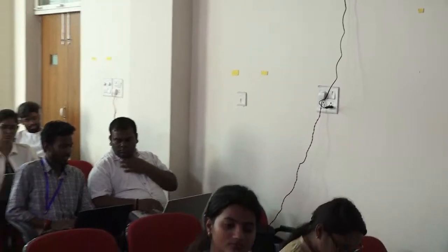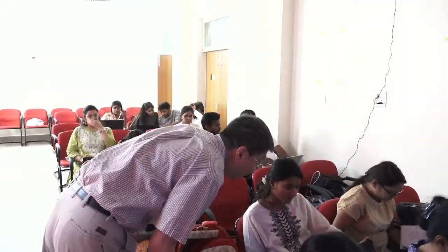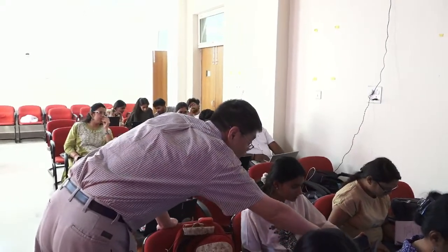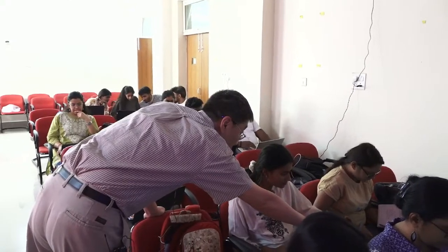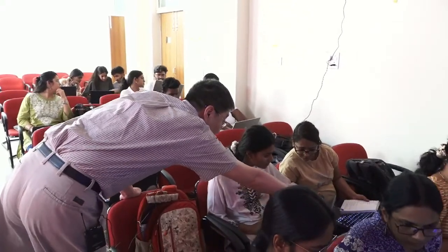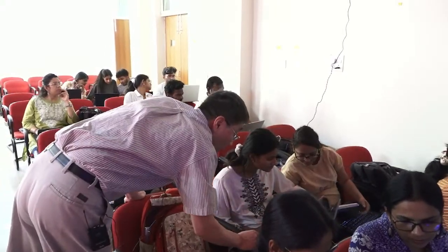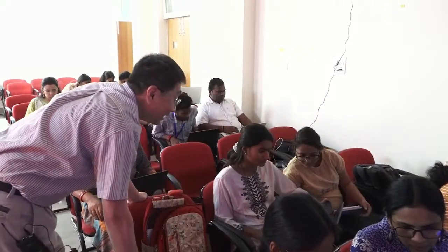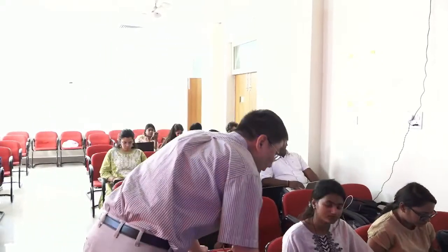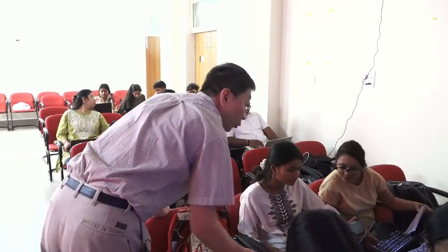So, okay. Go to Edit. No, Draw. You have Draw, right there. Well, which version is it? Oh, you're using 1.1. I'm sorry, I don't know how to use 1.1. I see, you're using a different version of Coot. So you have to somehow center on valine 2. Yeah, this is 1.1. We are using 0.9, so it's a different version.